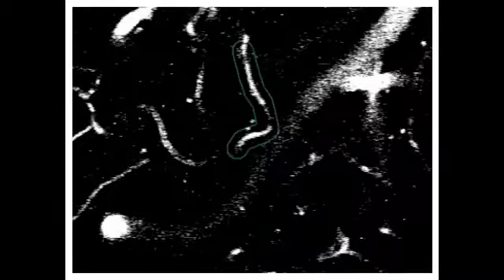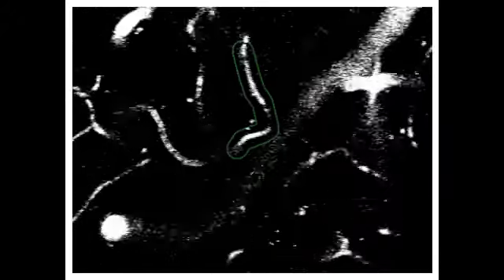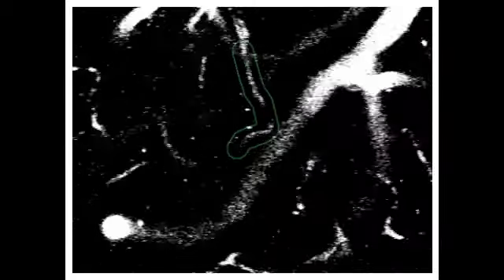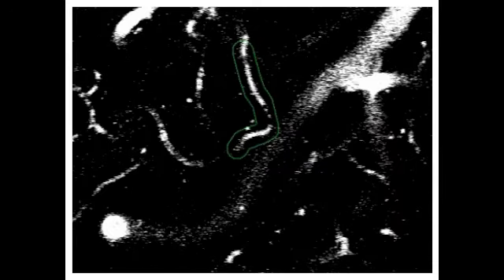This image has very high contrast and some graininess. It's pretty clear which vessel we're looking at — it very clearly follows the shape of the green outline. There's also a very distinctive stall right here where there's a dark gap. You might even see a few small connected gaps, and then there's a smaller gap up here. As we scroll back and forth, those spaces never fill in with the fluorescent fluid of the vessel. They remain dark because there are blood cells actually stuck in those spots. So this is a clearly stalled vessel.